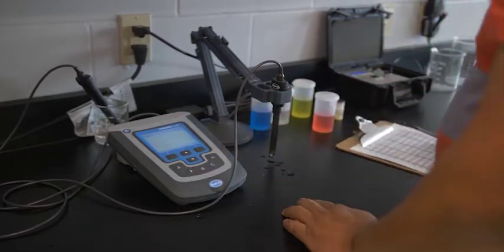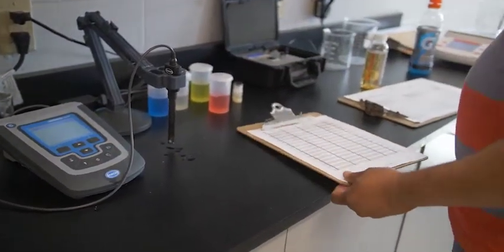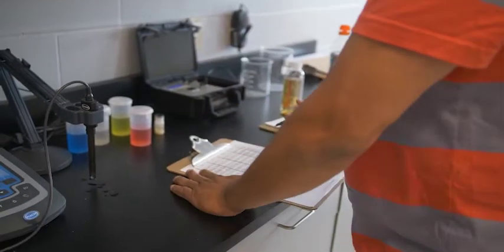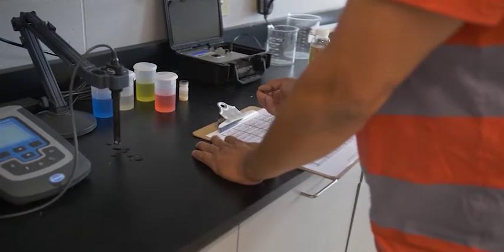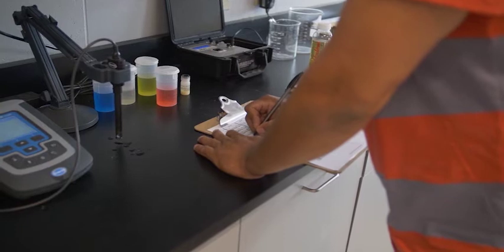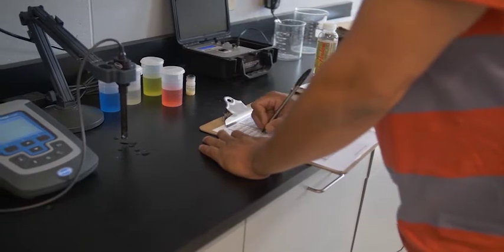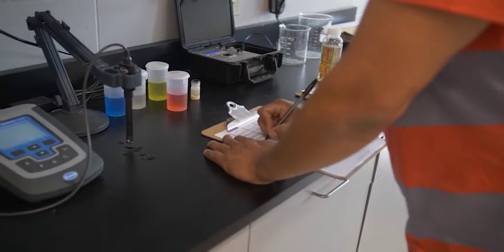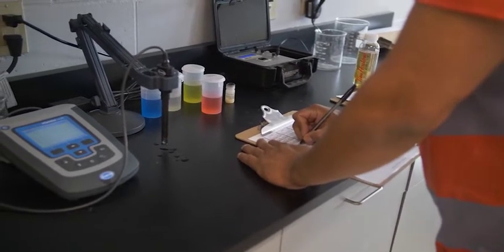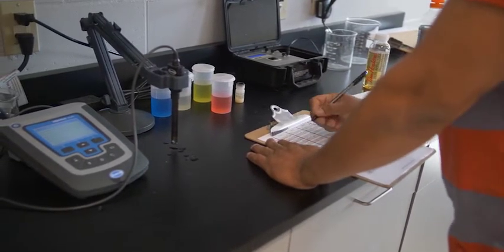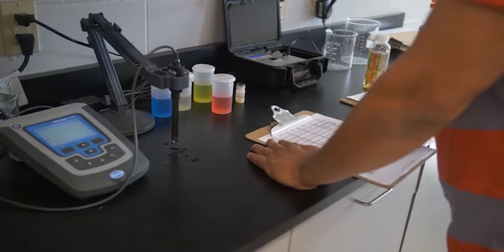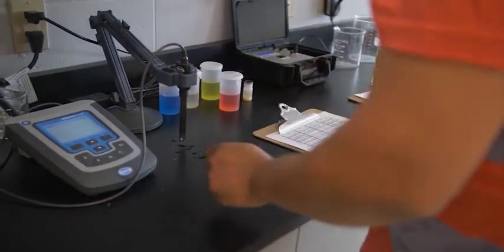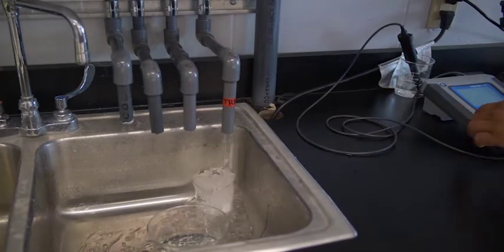And then all these numbers here we store that on our calibration page here, just to track and ensure that we're calibrating our instruments on a regular basis. And if anybody has like health ever questions anything then they'll know like hey you guys have been doing your calibrations. I do see it on your sheet. So I do trust your instruments for the pH and the conductivity.